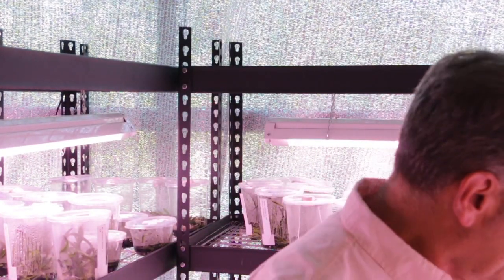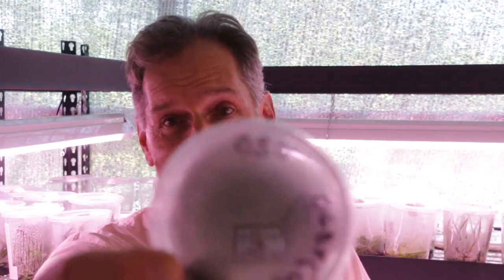All right, here's a situation, and I'm going to show you a plate and there's nothing in it. You're not going to be able to see it because it's cloudy, but there's nothing in it. This was a Cattleya cross that I made, and it took 6 months for me to recover the seed from this, and no embryos in those seeds. I didn't see anything. Sometimes it's difficult to see the embryos, but these are big Cattleya embryos. What I should have seen was big Cattleya embryos, and I saw nothing. So this was 6 months that I had to wait to get these seeds, and then I saw nothing. And this happens, so don't always expect it to be a green ocean when you do these platings.